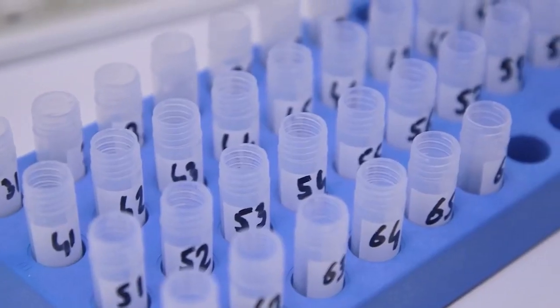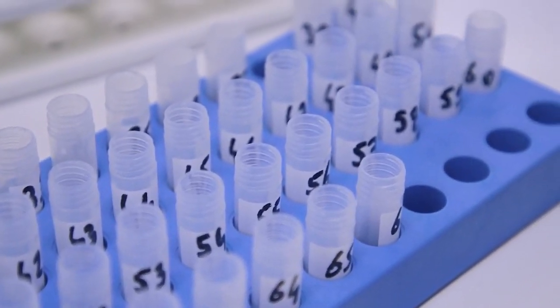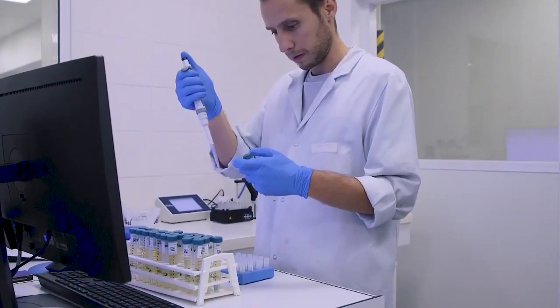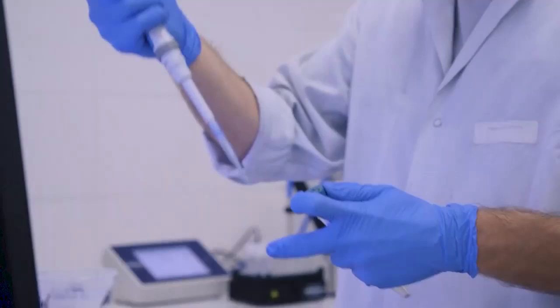The supernatant liquids are transferred from the centrifuge tubes into pH tubes, ready for automatic pH adjustment using the Bruker BT-pH unit.